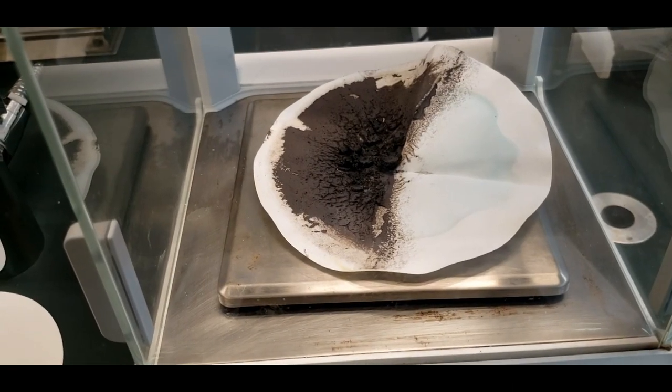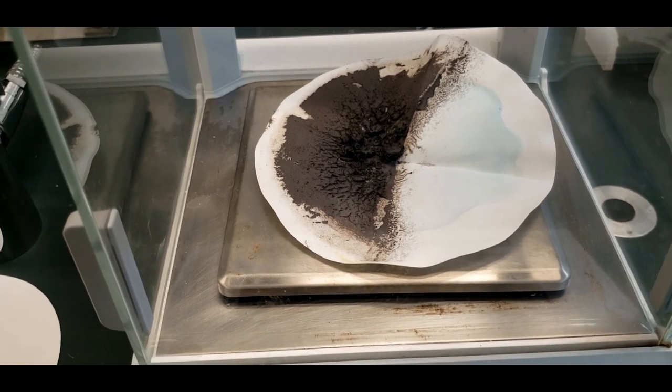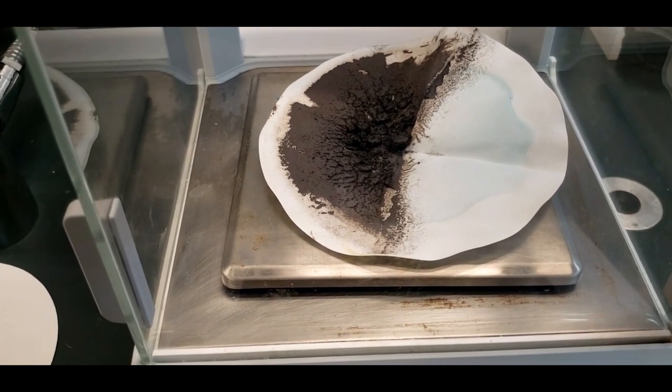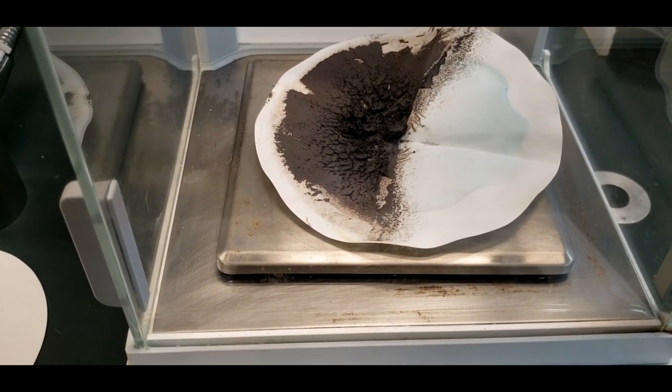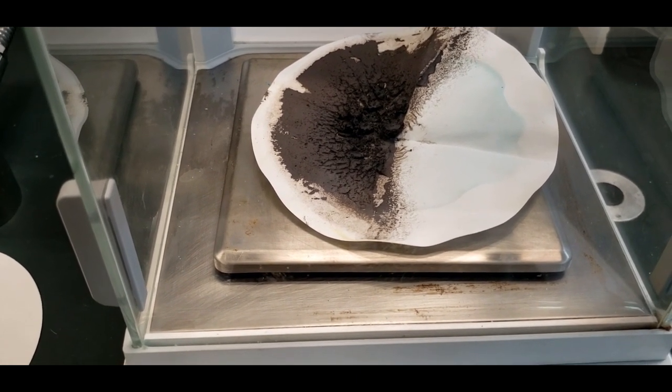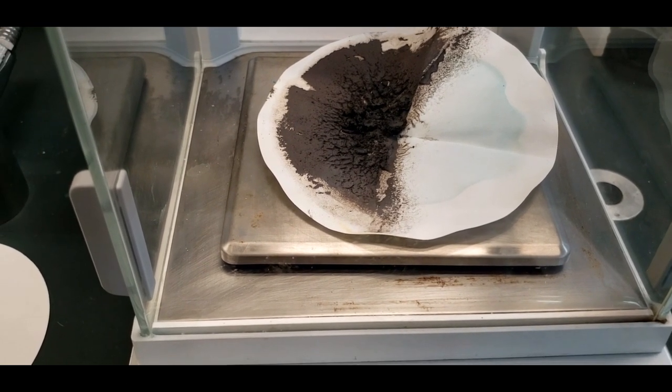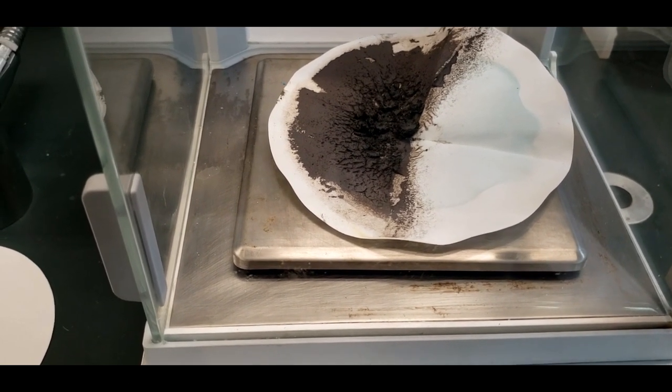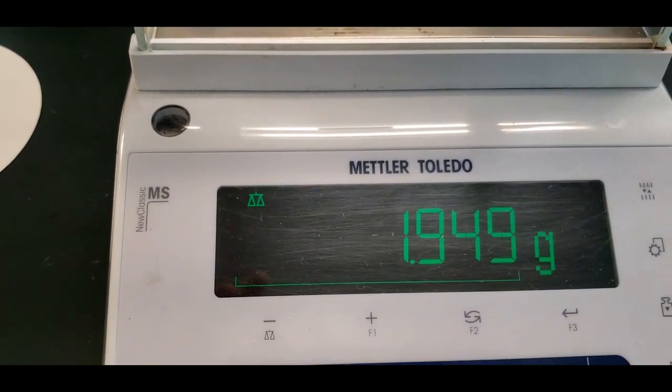Here's the sample, I just took it out of the oven and put it right onto the balance. You can see that it's very dry. I moved it around, it's very crumbly. I think it's perfectly dry, but you can see that little blue there. That's the copper two ion that was still in the solution. So we probably lost a noticeable amount of copper. Let's see what the mass is: 1.949.